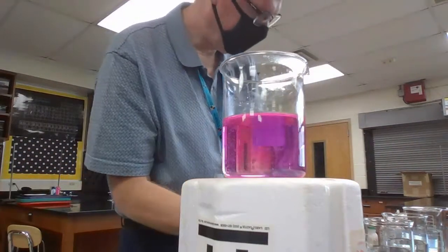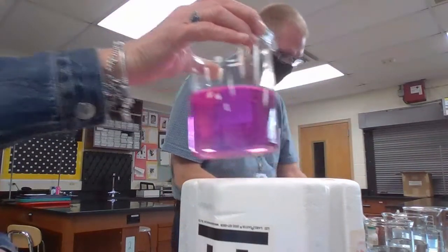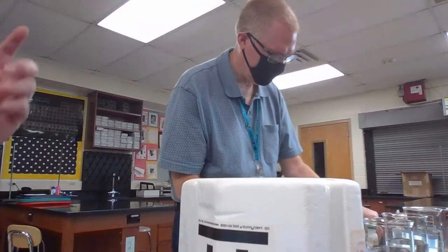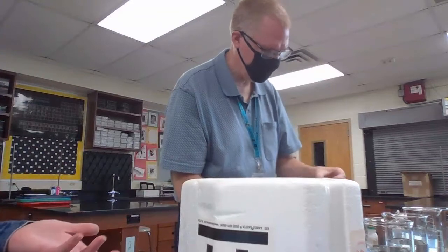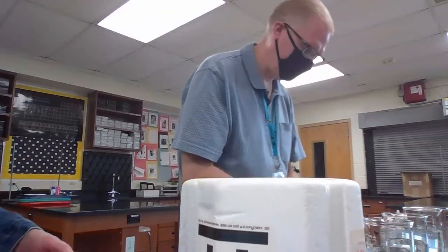All right, the next one we're doing is sodium. Everyone, if you need to, pause the video so that you can write down your observations next to the picture of the battery, because a lot of the batteries that we use now are made with lithium.